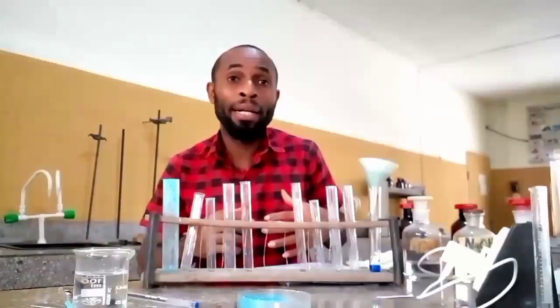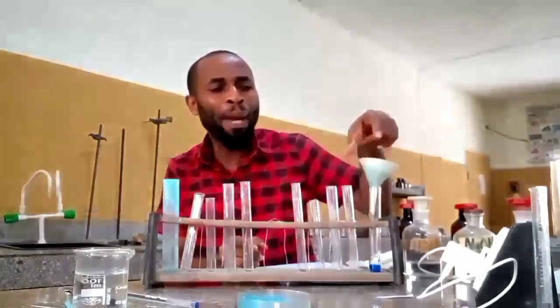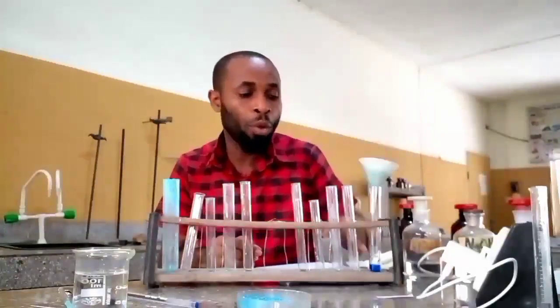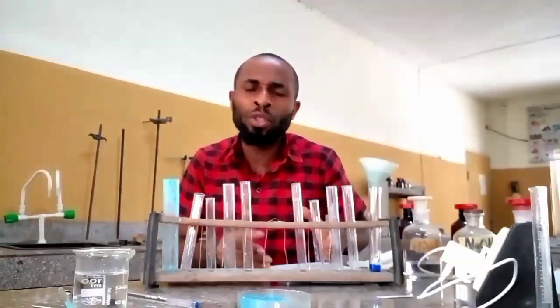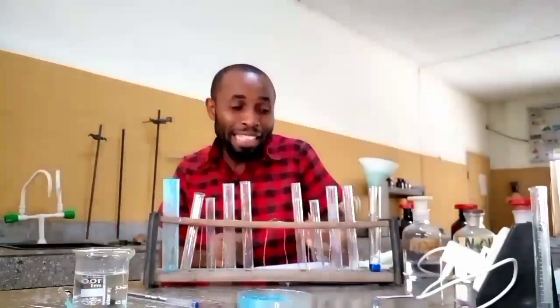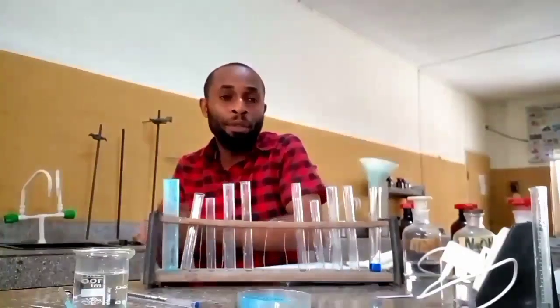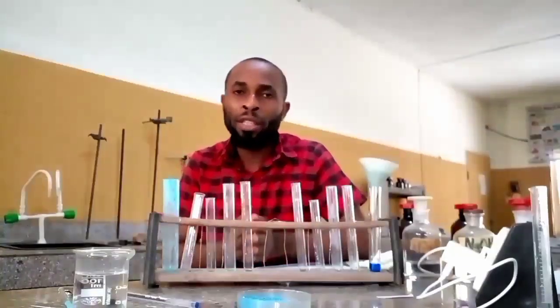But if you look at what I said in my introduction of this, I said that it's supposed to give us a colorless solution and a pale blue solution. This is the pale blue, but here it is not giving us a colorless solution. It is rather giving us a deep royal blue, a deep blue solution. Then the question might be, why is it giving us a deep blue solution rather than what I just said before now, a colorless solution?